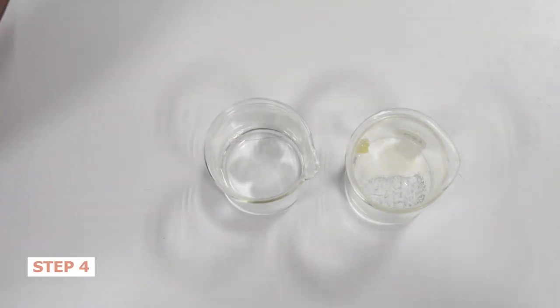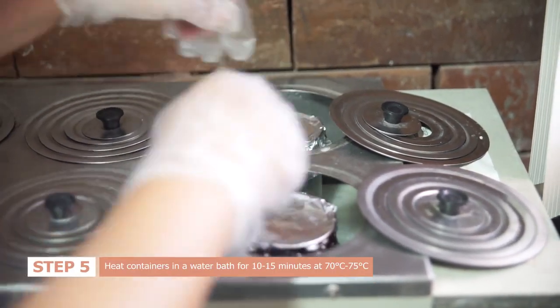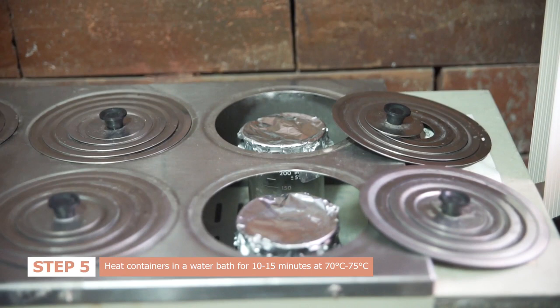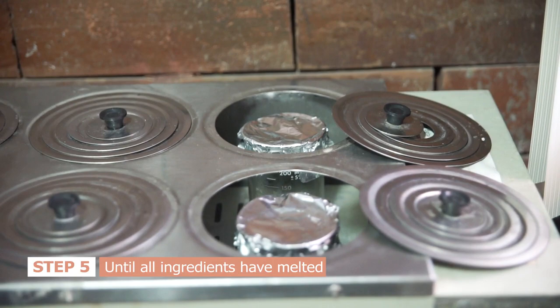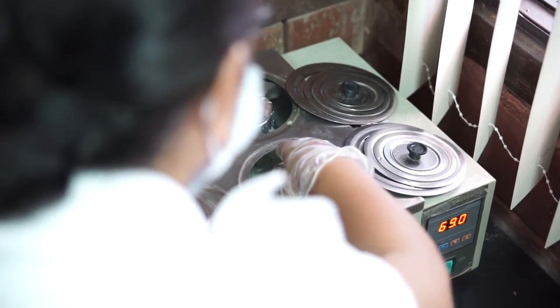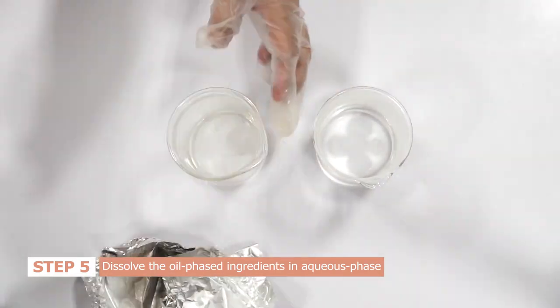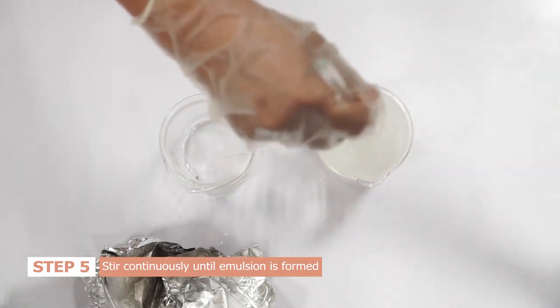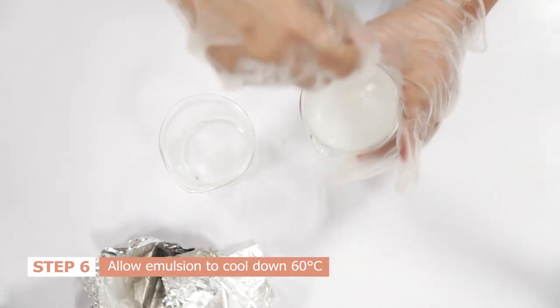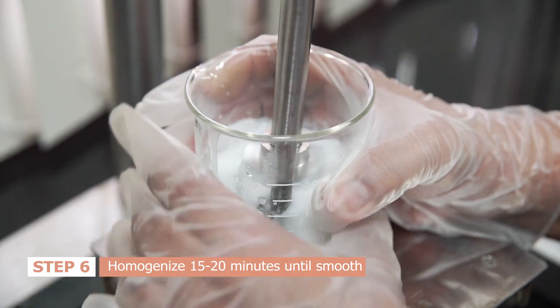Cover both containers with aluminum foil. Heat both containers in a water bath for 10 to 15 minutes at 70 to 75 degrees Celsius until all ingredients have melted. Once done, add the melted oil phase ingredients to the heated aqueous phase ingredient while stirring continuously until an emulsion is formed. Allow the emulsion or the mixture to cool down to 60 degrees Celsius and homogenize for 15 to 20 minutes until smooth texture is attained.